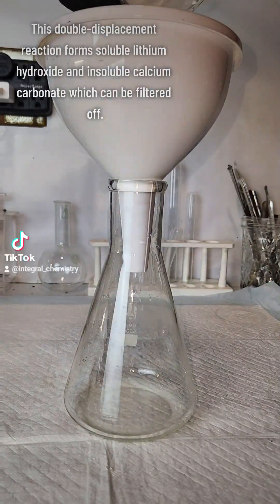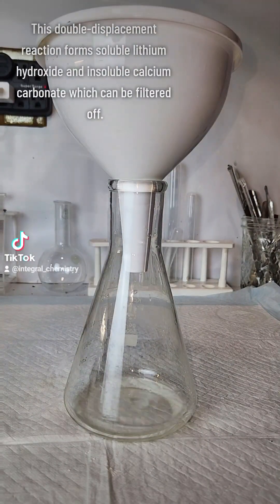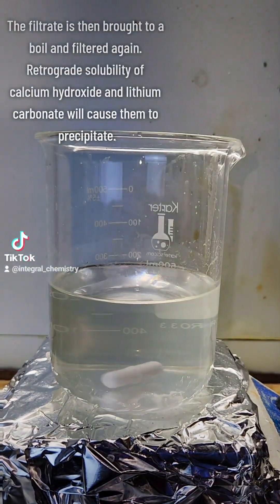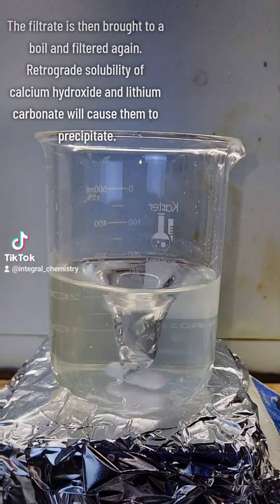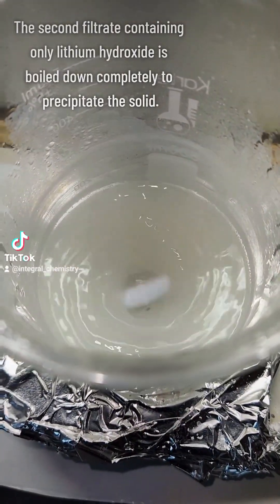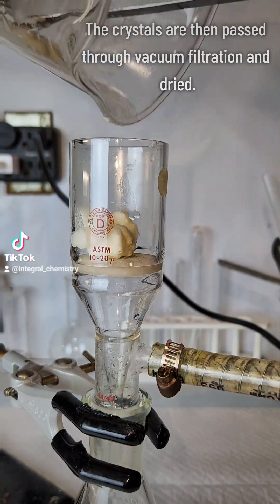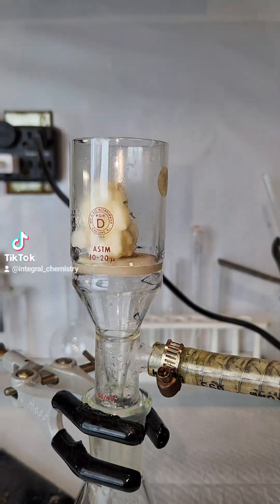I mixed 37 grams of both in cold water for about an hour, and this will yield lithium hydroxide and calcium carbonate. Calcium carbonate is completely insoluble, so this is filtered off and the filtrate is brought to a boil. This will cause any calcium hydroxide or lithium carbonate that might have slipped through to recrystallize due to their retrograde solubility. The solution is filtered again to remove those.